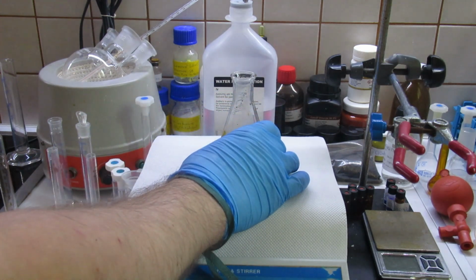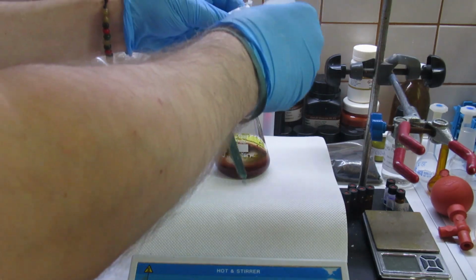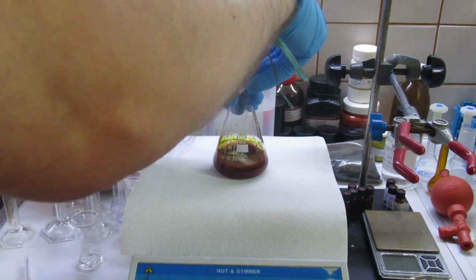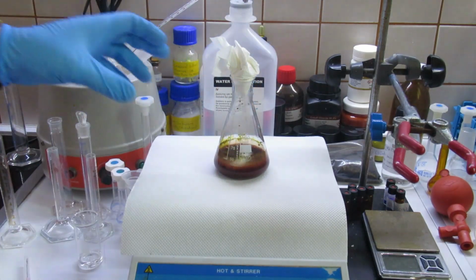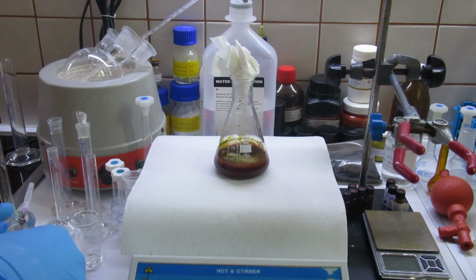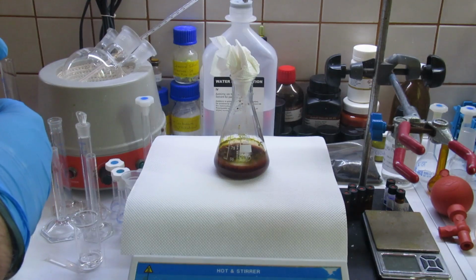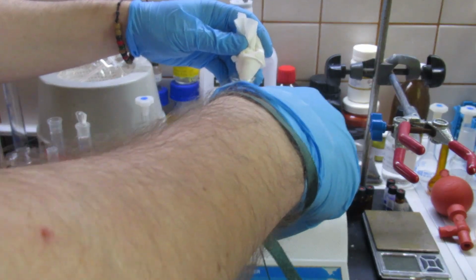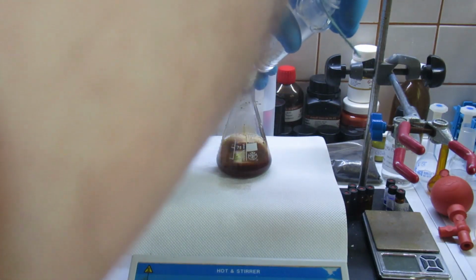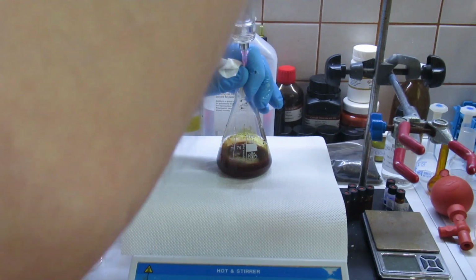And then what we're gonna do is take some paper towel, and do not use a rubber stopper for this because it will blow out, and take a syringe with 30% concentrated hydrogen peroxide, slide it in very carefully, and start adding the peroxide dropwise.